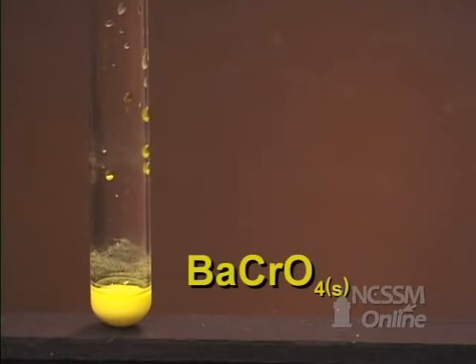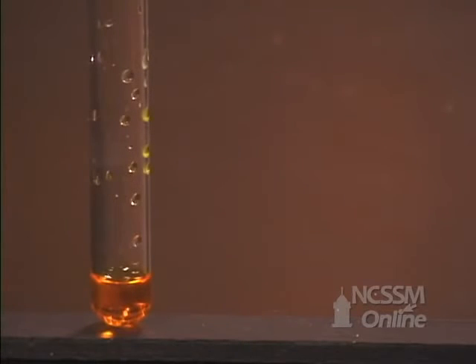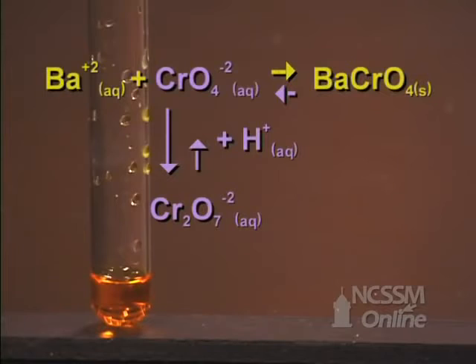If we take some of the solid barium chromate and add 6 molar nitric acid, we see that the solid goes back into solution and the solution turns orange. Adding the nitric acid provides a source of hydrogen ions. The hydrogen ions combine with the chromate ions and shift the equilibrium in the reverse direction to form dichromate.